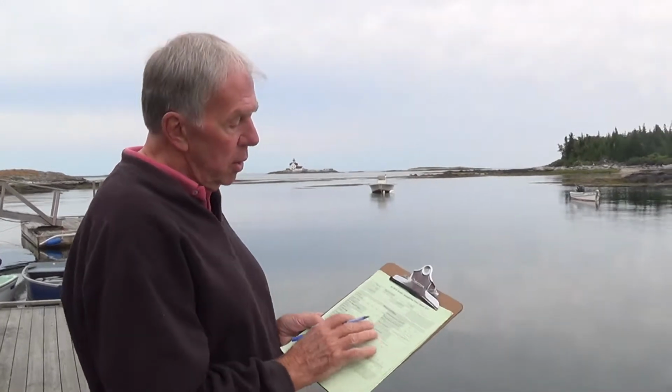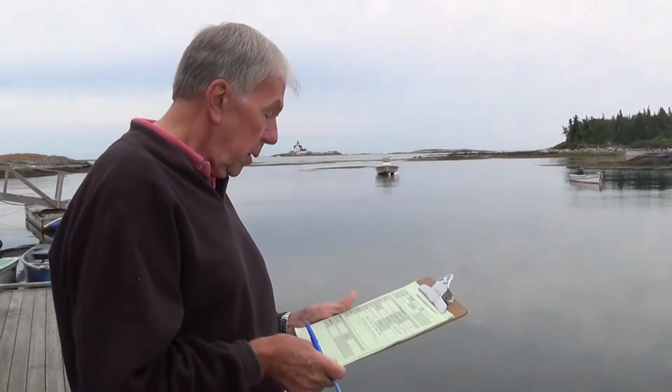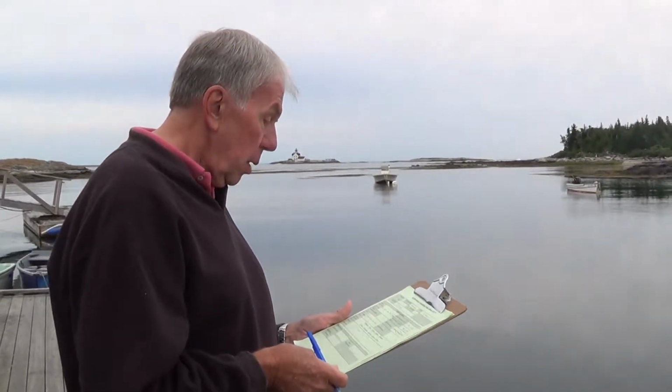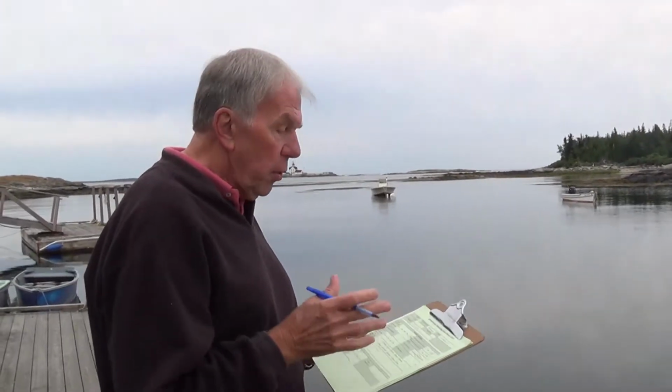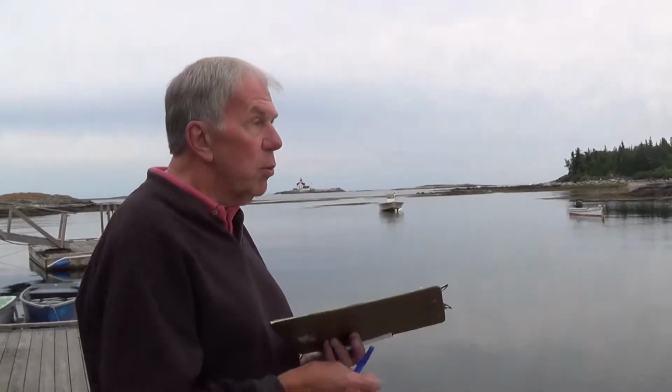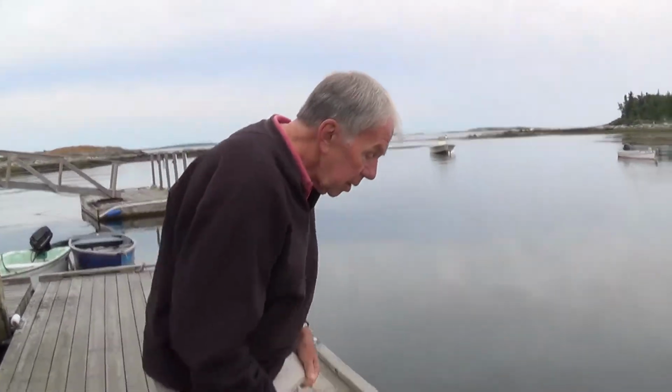It is also in this block for air temperature, but when we get to the instruments and how to use them, I'll show you where that thermometer is to measure air temperature. All right. We've covered the principles right now. Before I take a water sample, there's one more thing we want to do, and that's using something called the Secchi disc, and that measures water clarity. So let me get that right now.